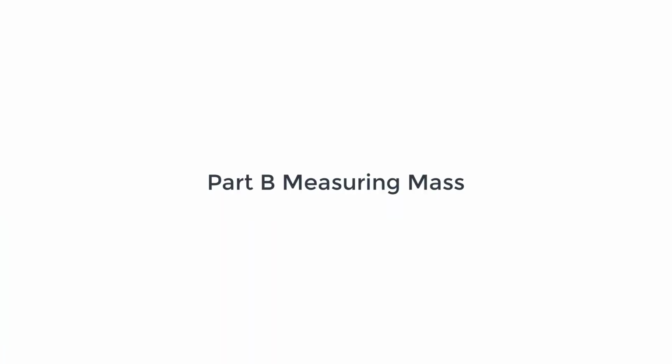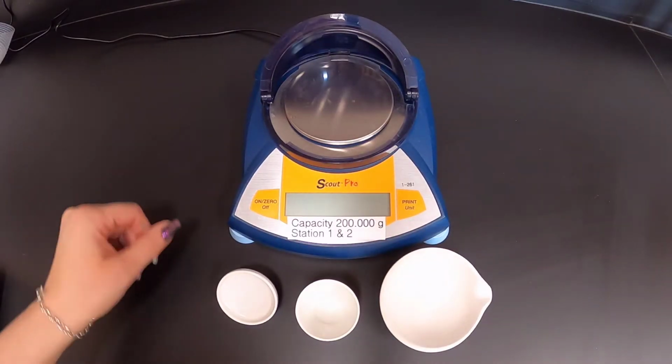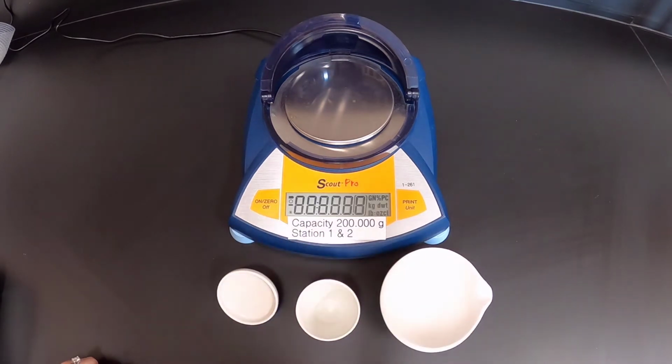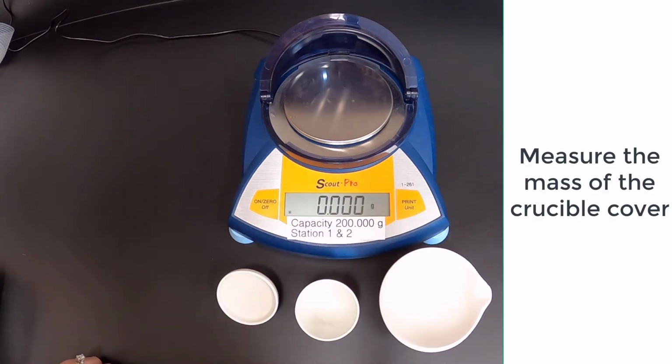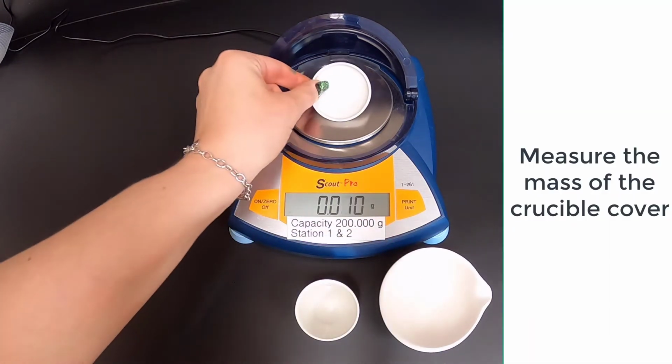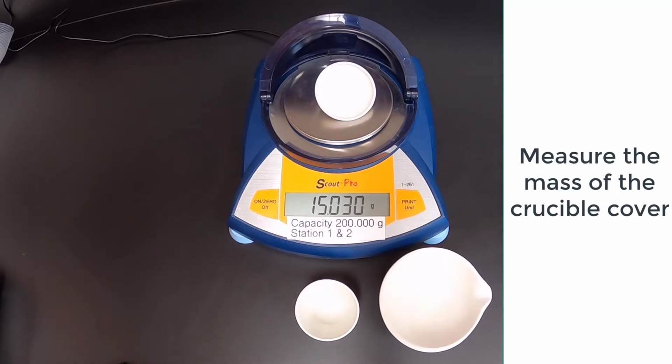Part B, Measuring Mass. Measure the mass of the crucible cover.